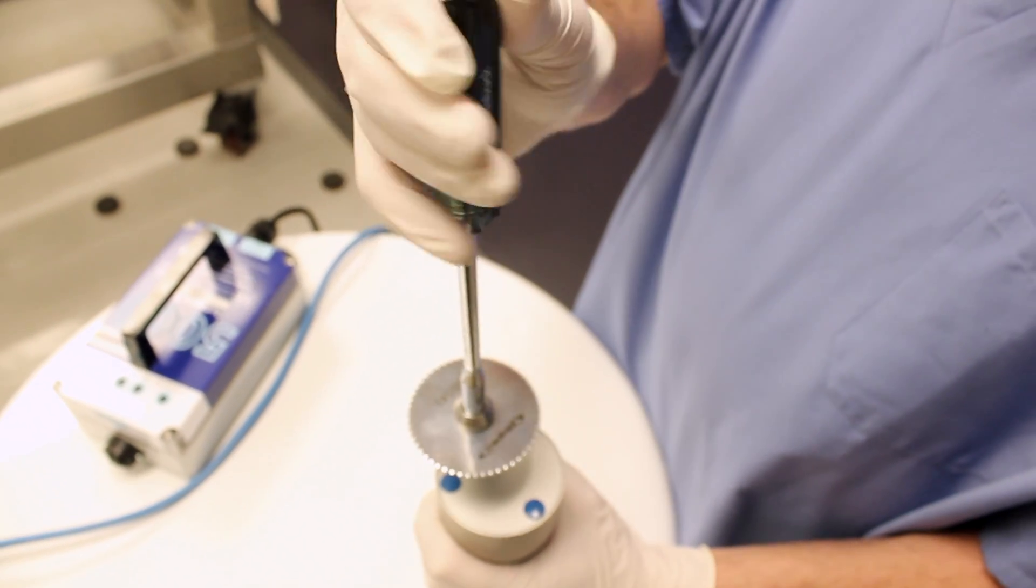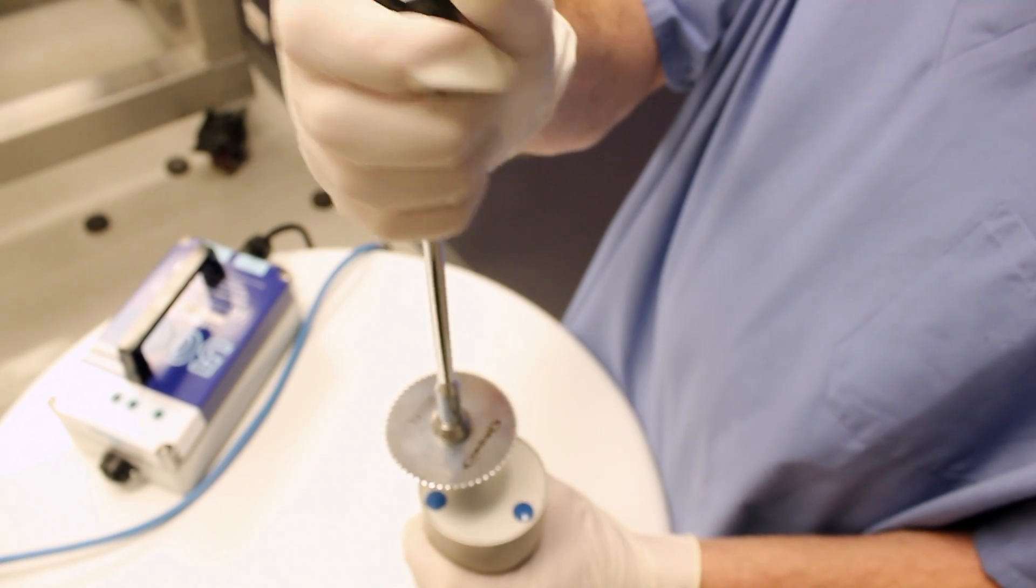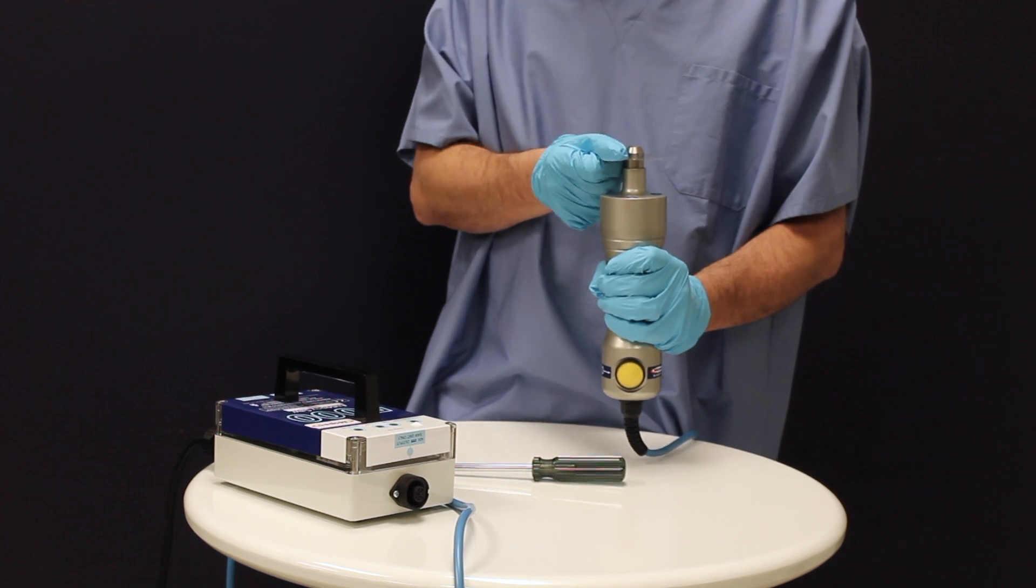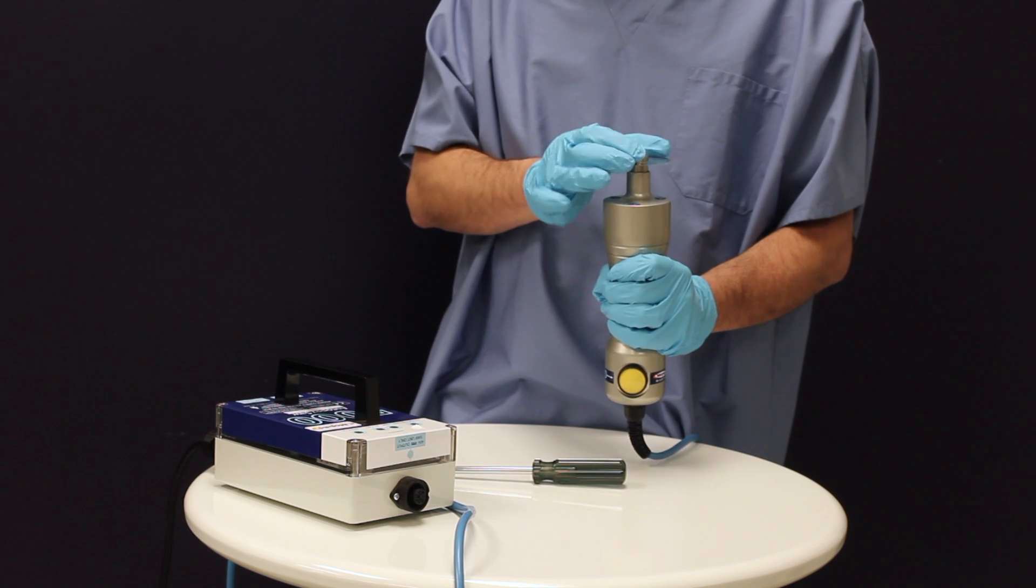It is important not to strip the screw by using the proper torque application. By applying minimal pressure on the blade, make sure the blade is not loose and makes contact with the clamp.